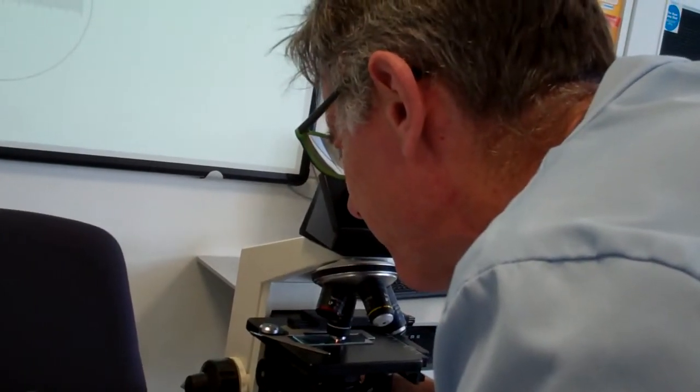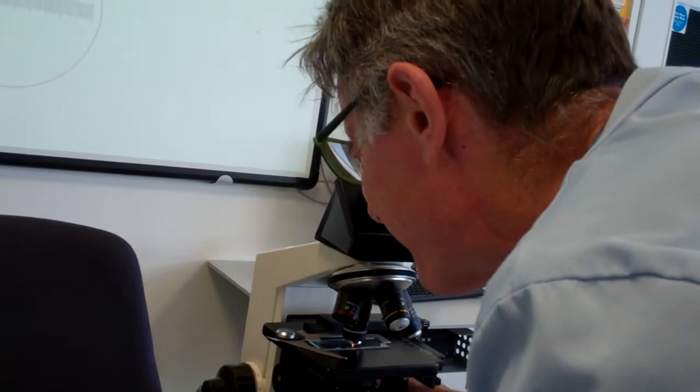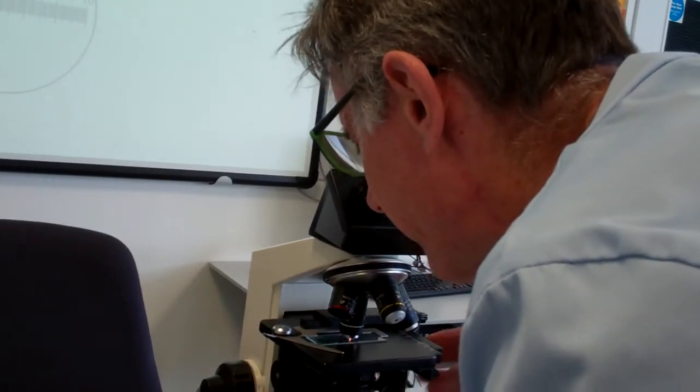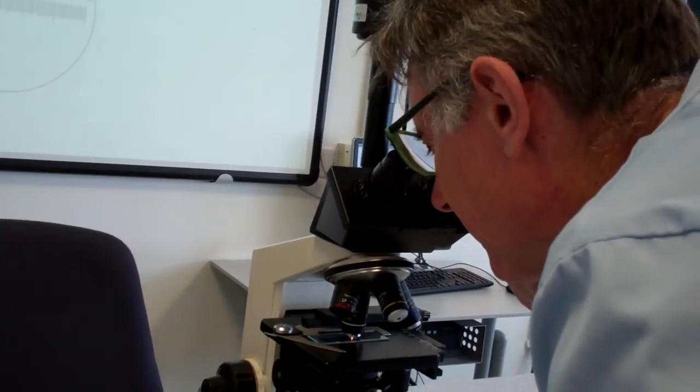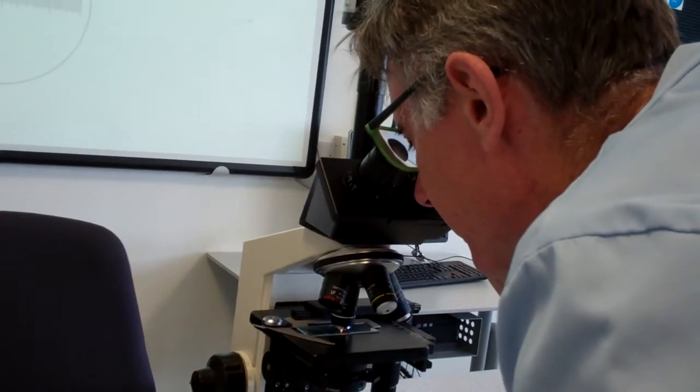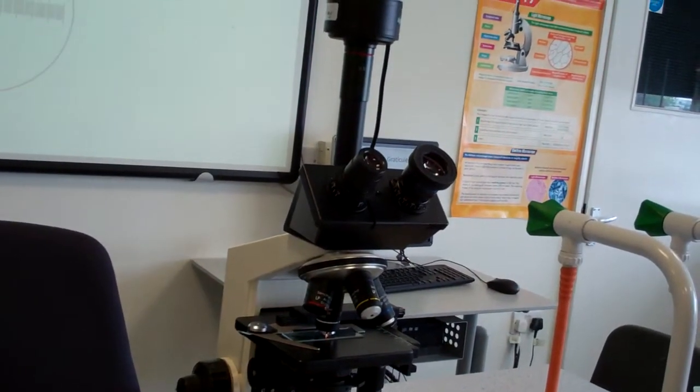Get the image in the middle, put it in the middle, and then rotate and line up the eyepiece graticule. Here's one I did earlier.